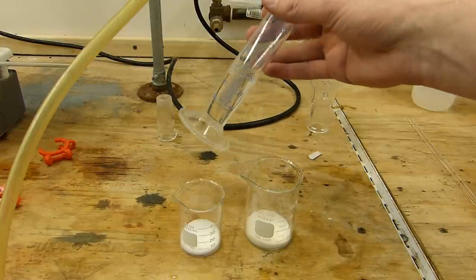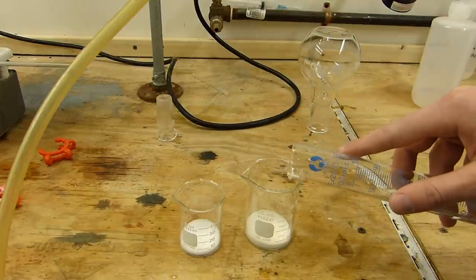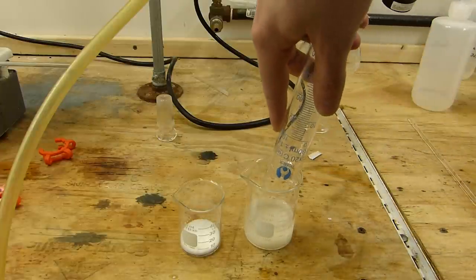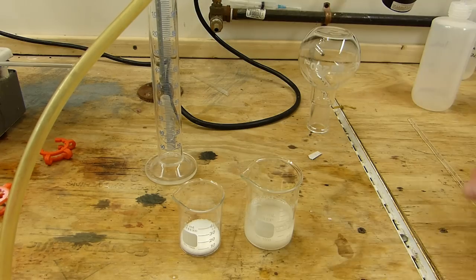Mine's a drain cleaner. You have 30 milliliters of water for every 13.2 grams of ammonium sulfate. You simply pour it together. The solution will get really cold as it dissolves, and it will dissolve eventually. Just give it a small stir.